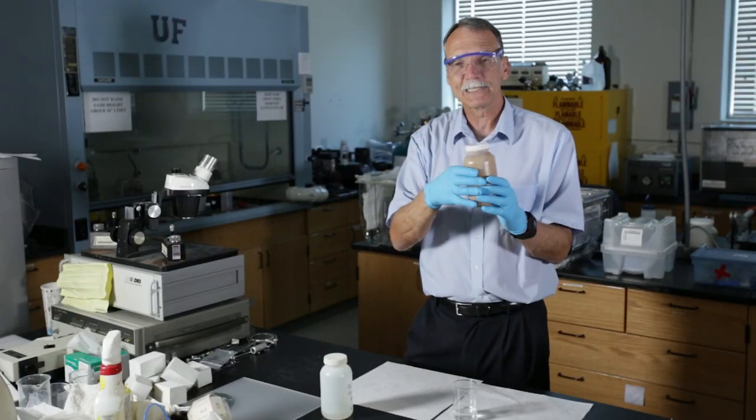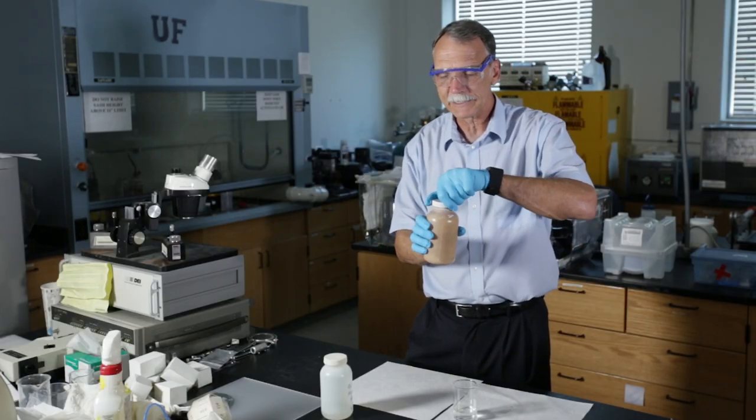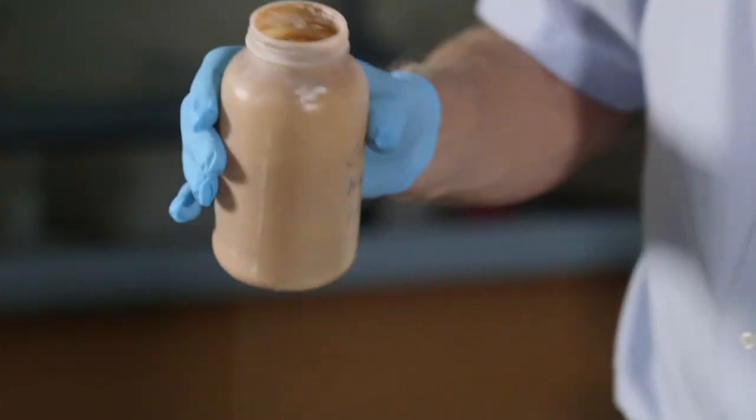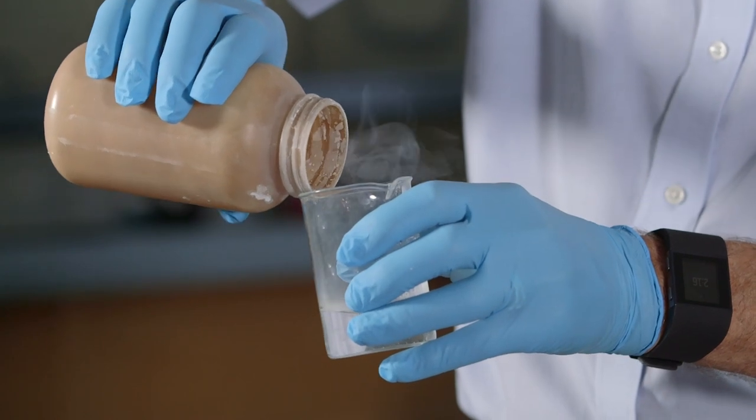So what's going to happen is that when I pour this in, on the surface it's going to be actually lighter because it's dissolved in heptane. And so when I dissolve this thing, here, I'll pour it on here.